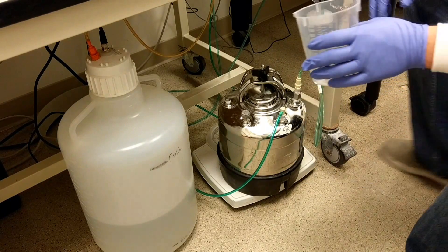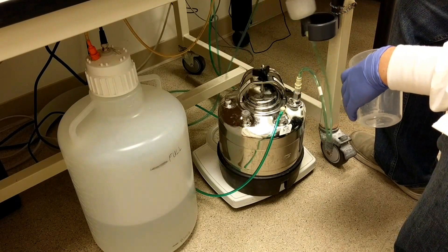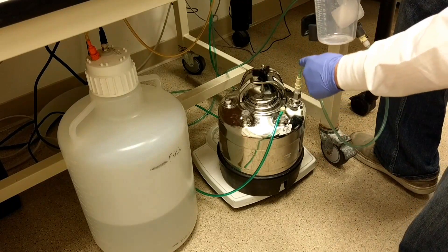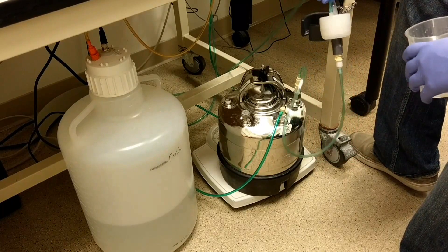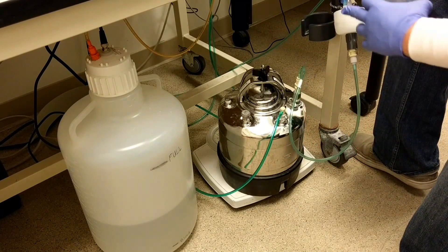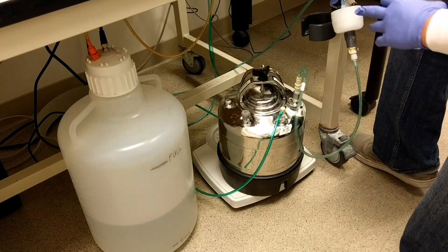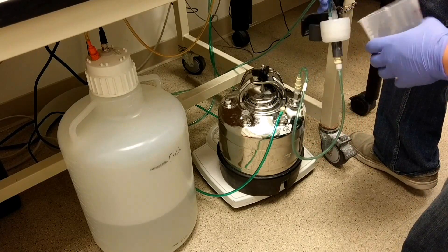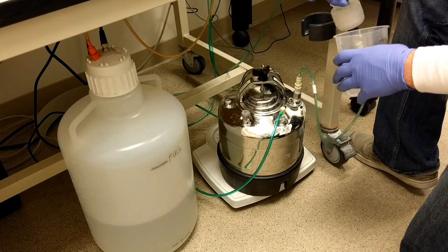The last thing you want to do is bleed any air out of the lines that has been introduced or in the sheath filter. You might see some air bubbles in this line, and this roller valve will allow those air bubbles to come through and allow you to bleed any air out of the sheath filter.